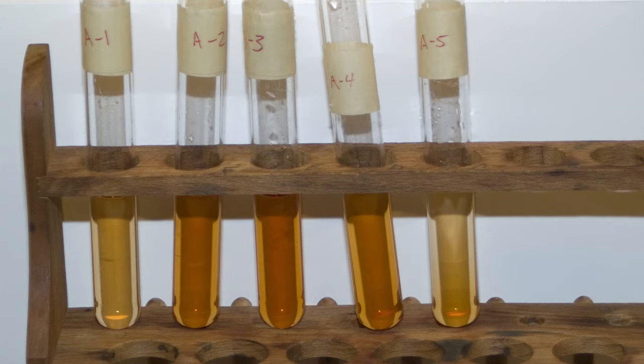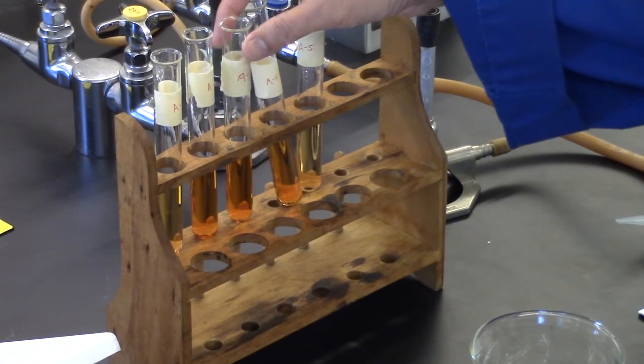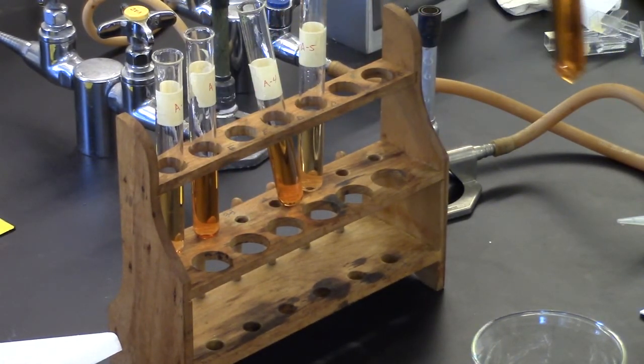For this experiment, the variable is the absorbance and the maximum will be determined. You have already measured the absorbance of the sample A3.